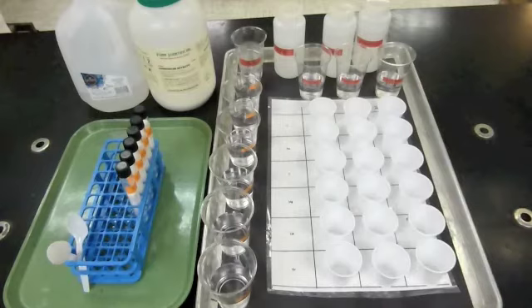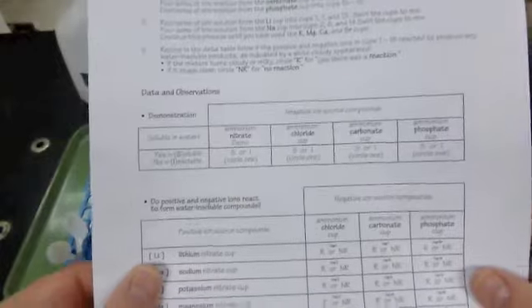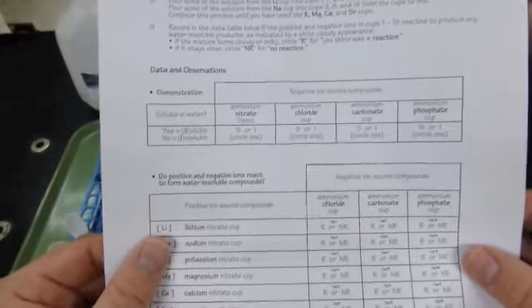And what you want to do is look in the cups and see if the mixture that you make is clear, in which case everything is soluble, or not clear. If it's cloudy, if it looks like white milk, then that's going to be insoluble. And we'll keep track of the solubility of the materials that you're working with on the data table.